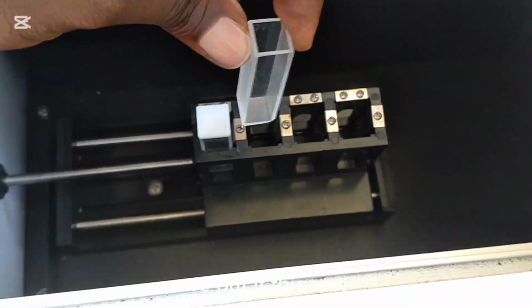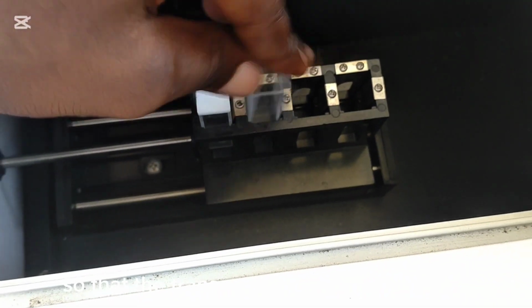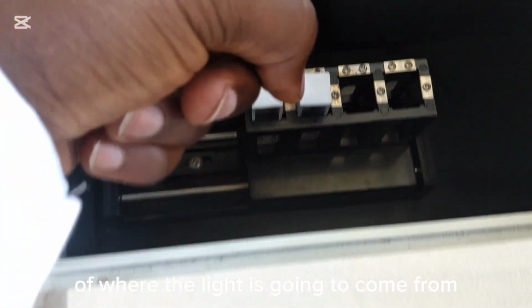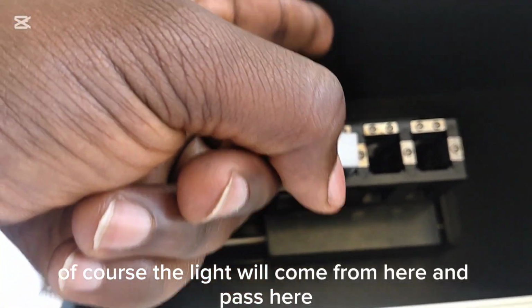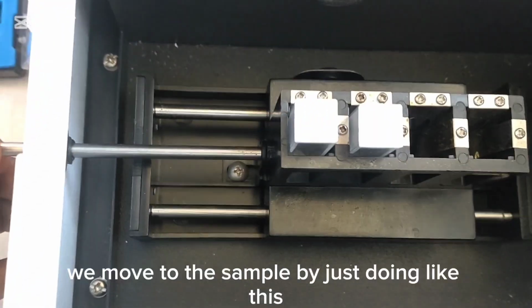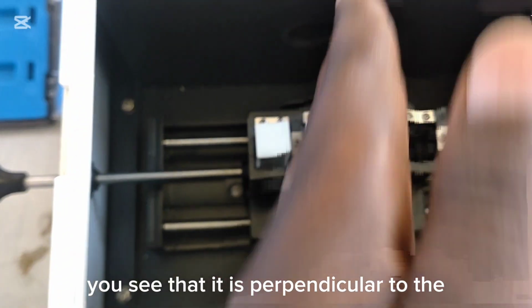We put it this way so that the transparent side is on the edge where the light is going to come from. Of course, the light will come from here and pass here, then be detected here. Then we move to the sample by just doing like this. You see that it is perpendicular to the light, or parallel to the light.